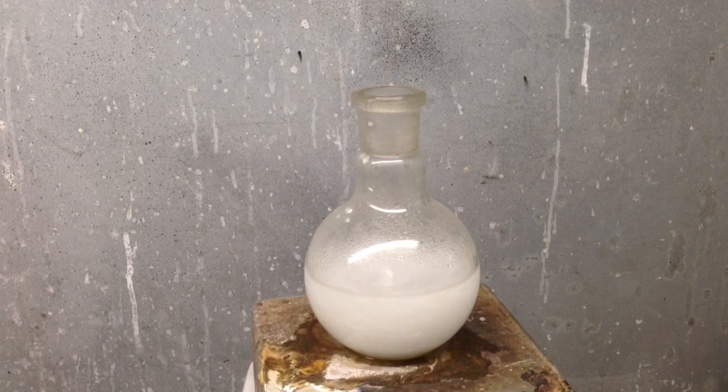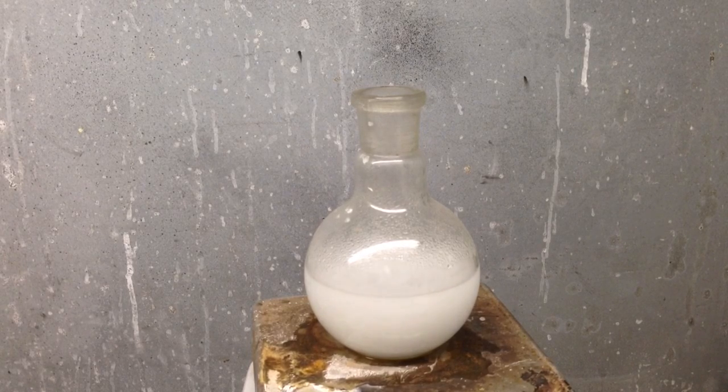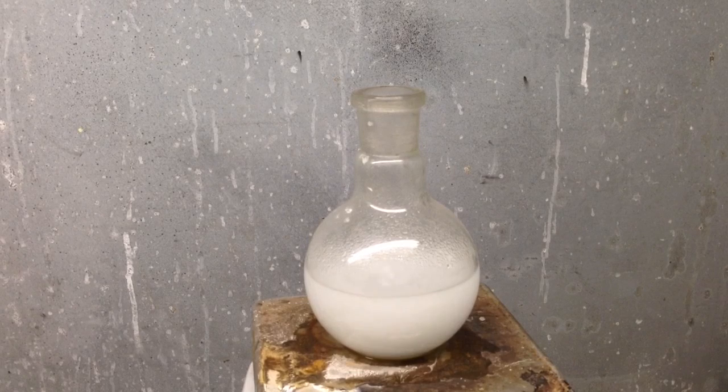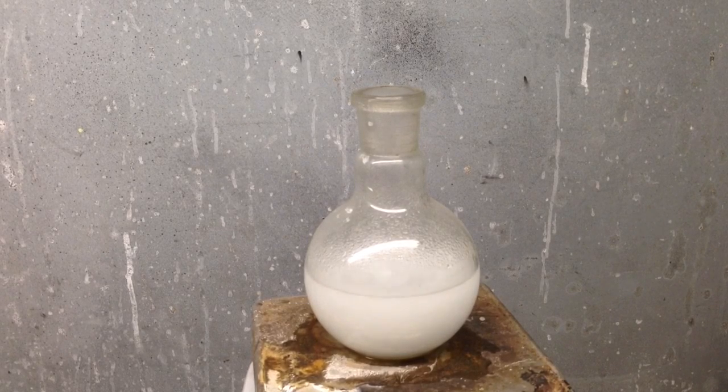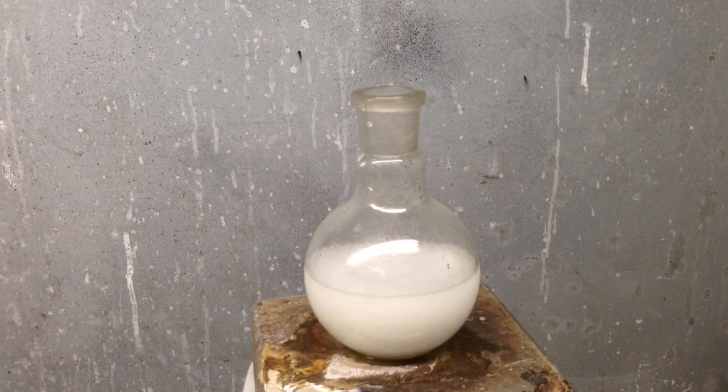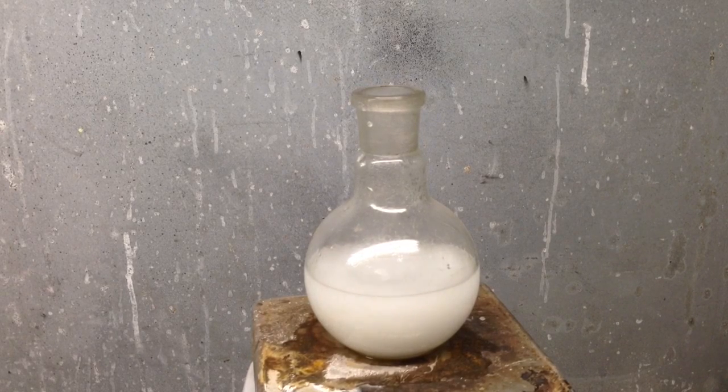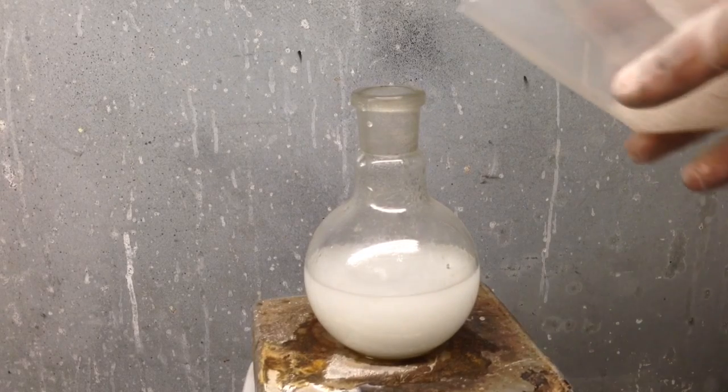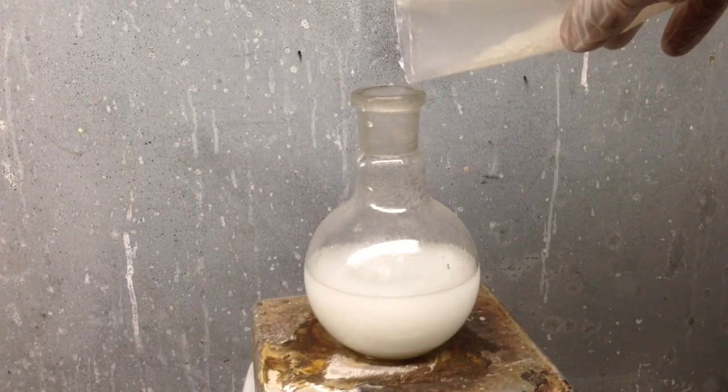So like I said, I started with about a quarter to a third of the amount. We'll let that dissolve a little bit. Alright, so I've been letting this heat up for a little while. We'll go ahead and add the rest of the silica gel.